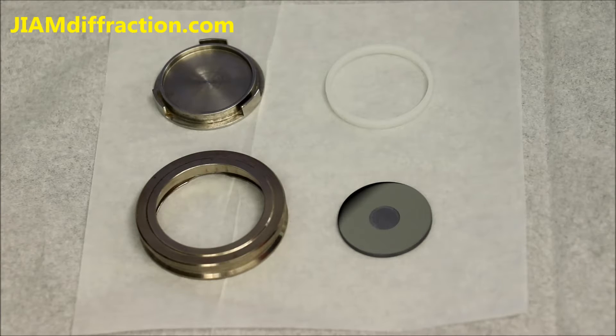In this video I will show you how to prepare a sample if ambient air affects it, as is the case for hygroscopic samples. One major item to note is that while I am demonstrating this in ambient air, this process should be performed in a glove box.